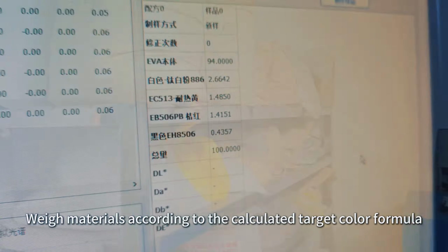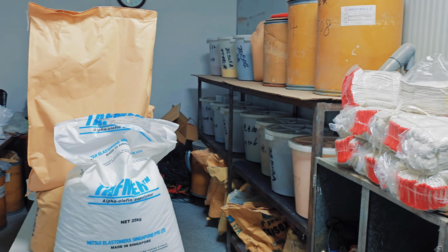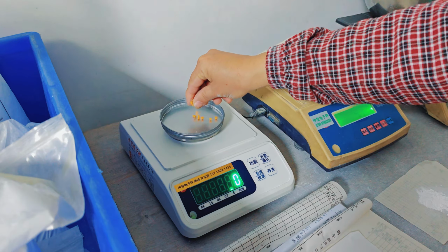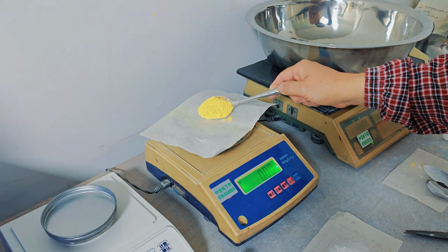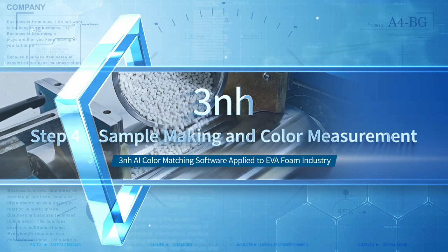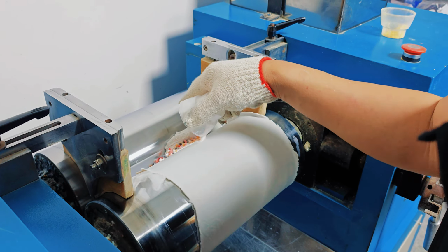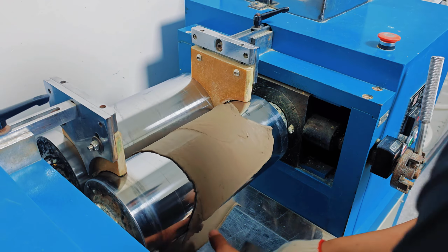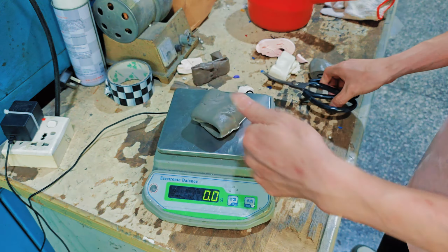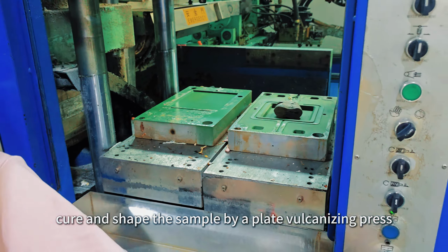Weighing materials according to the calculated target color formula. Mix the materials evenly with a roller. Then heat, cure and shape the sample by a plate vulcanizing press.